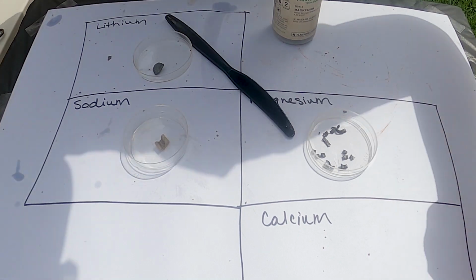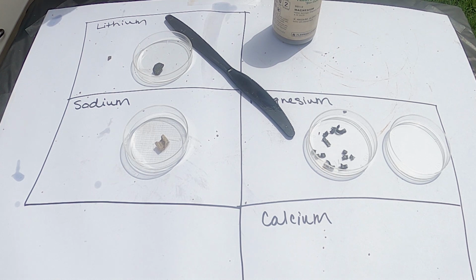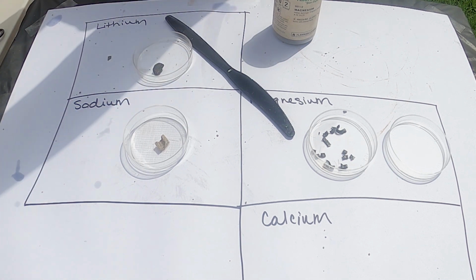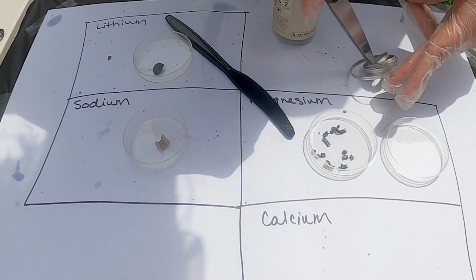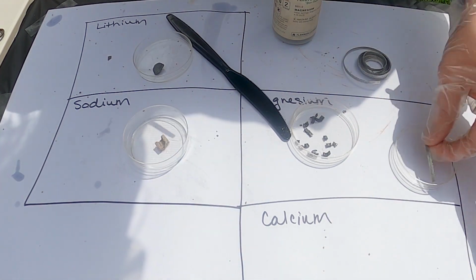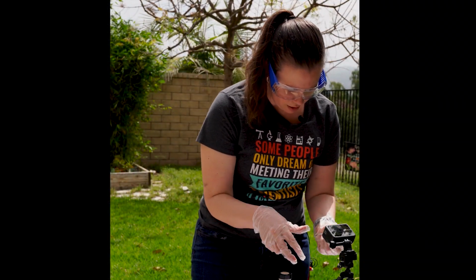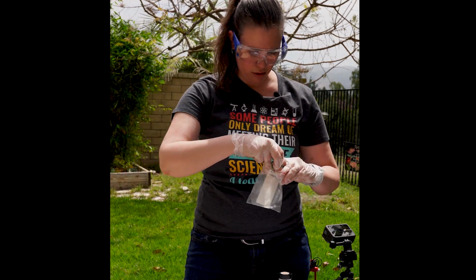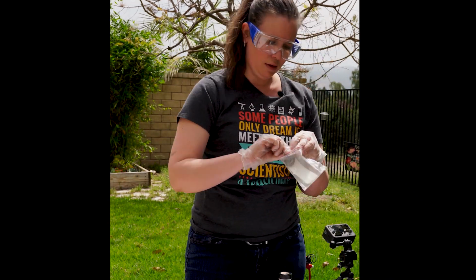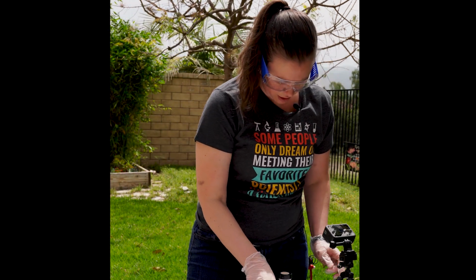There's another form of magnesium you may be familiar with. We use this in our molar volume of a gas law lab. It's a metal ribbon. It comes nice and stringy like this. We'll cut off a little piece of the ribbon. You can see similar color there. These ribbons are a little more reactive. It kind of shows you the malleable nature that magnesium can have as well. The ribbons we store in secure little baggies that can be airtight. Can't seem to get my gloves to cooperate. Here we go. So those are 2 forms of magnesium that we have.